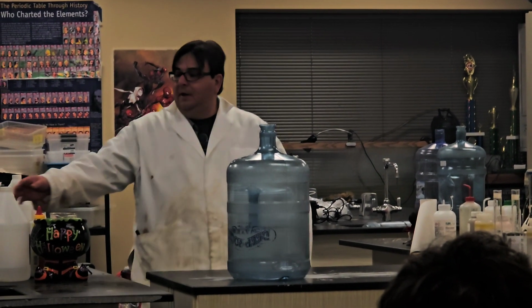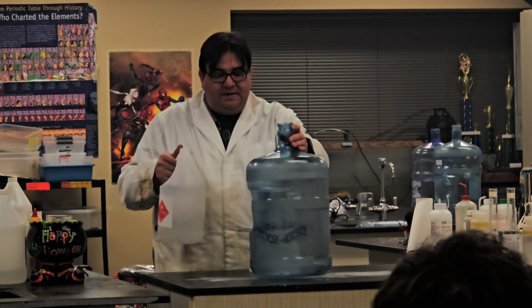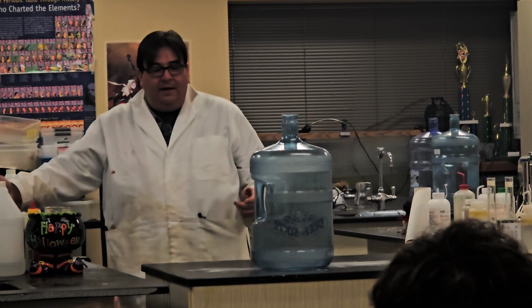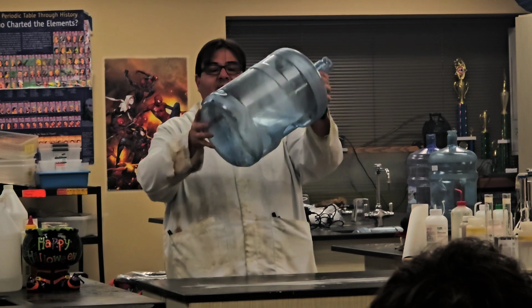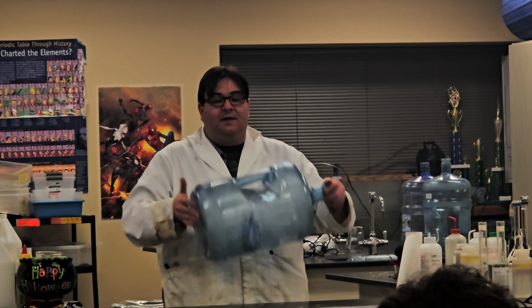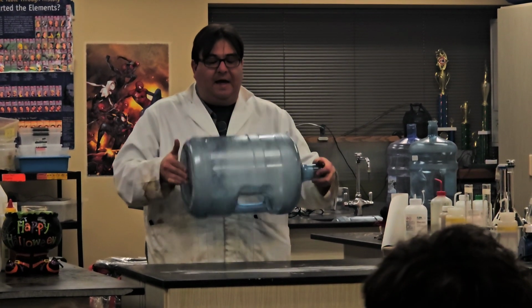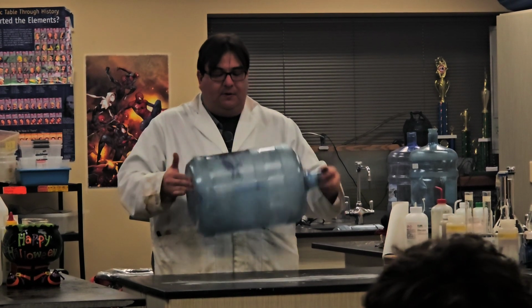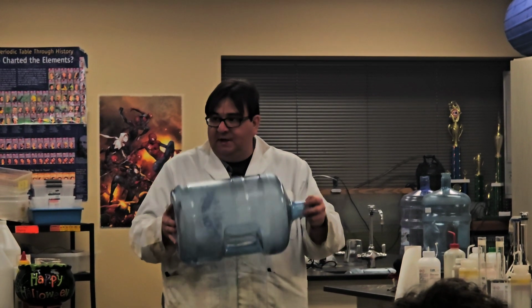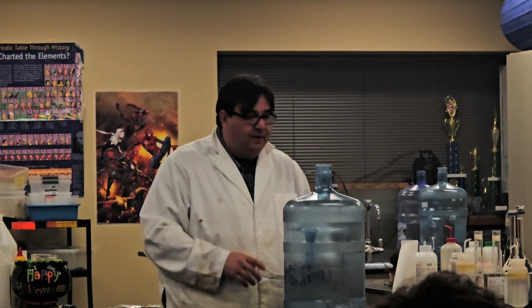So, one of the things that we'll go over throughout today is that it's not the actual liquid here that's flammable, it's the vapor. So I don't want to just put tons and tons of stuff. I want to have just enough inside of here so that when I spin it around, I'm able to maximize how much alcohol vapor is actually inside. By moving it around, I'm spreading all of the alcohol so that I can get 100% of the air inside of this saturated with alcohol. So I'll do a cool thing.